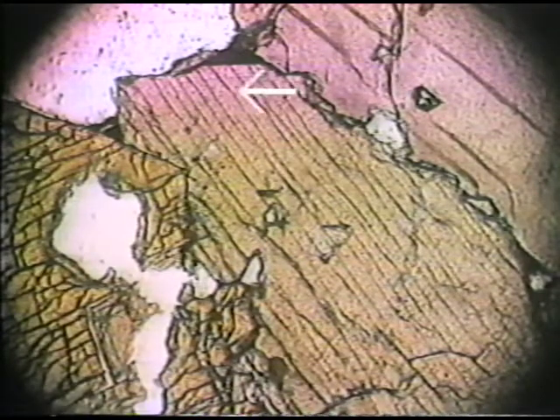Looking at the pyroxene grains, we can see really two kinds of pattern of cleavage. One kind of pattern occurs in grains that are more or less elongate in this rock and consists of one cleavage form, all parallel to each other. I'm pointing this out on this particular mineral grain. And another kind of orientation shows two intersecting cleavage forms, as exemplified by this particular grain.